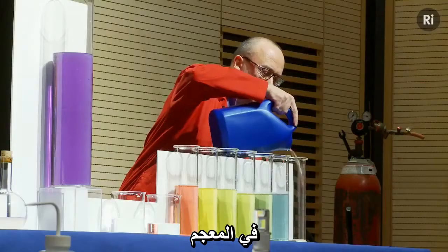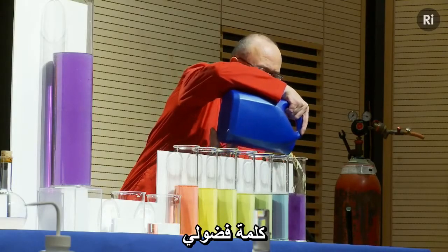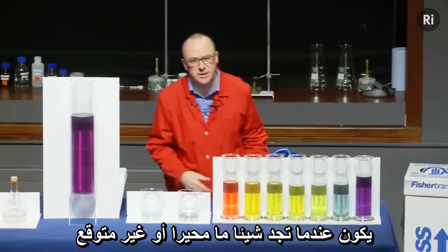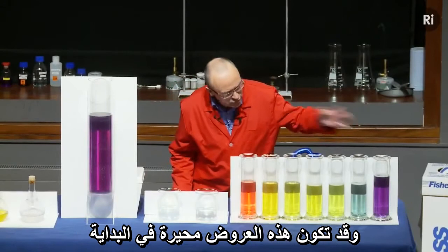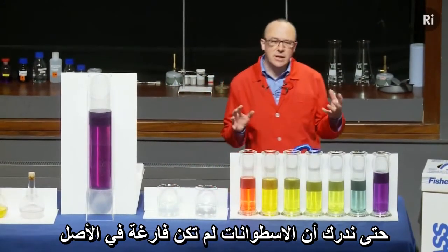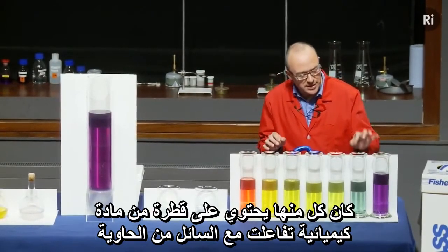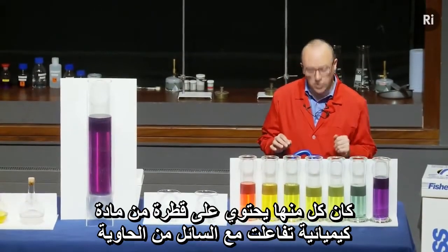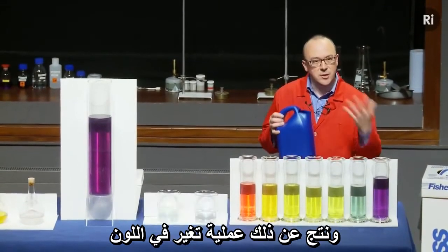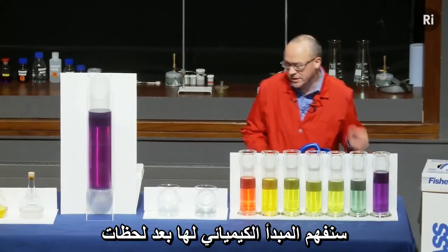In the dictionary the word curious is defined to mean something which is puzzling or surprising or unexpected. This demonstration might seem rather puzzling at first, until we realised that the cylinders were not empty at the start. Each of them had a little speck of chemical which reacted with the liquid in this container and produced a colour change. We'll look at the chemistry of that in just a moment.